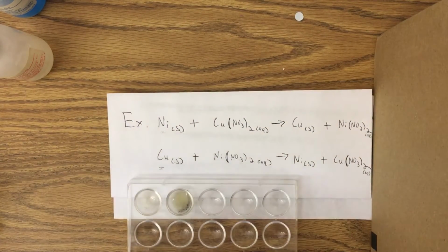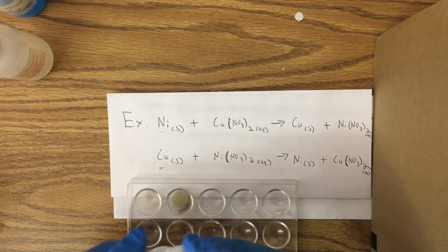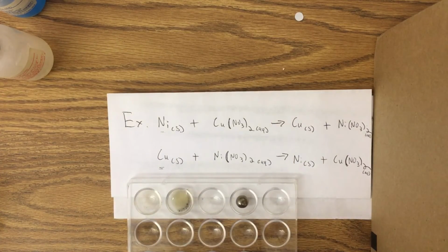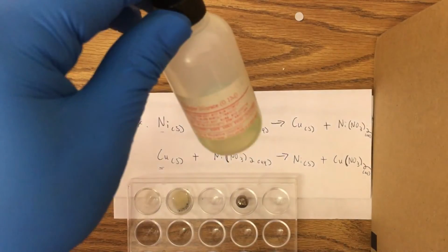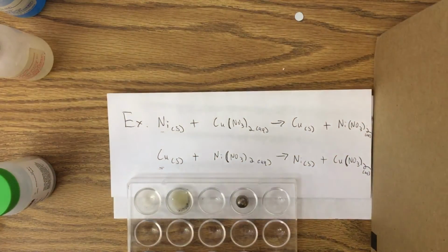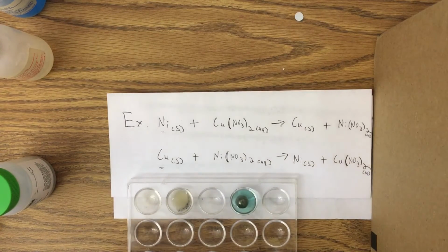I have some nickel, and I'm going to add it to my well plate, and I have a solution of copper nitrate, just right here. So if I add copper nitrate to this nickel, since I believe nickel is a more active metal, we should see some level of reaction occurring. And I'm going to completely coat this nickel to see if we can elicit a reaction here.